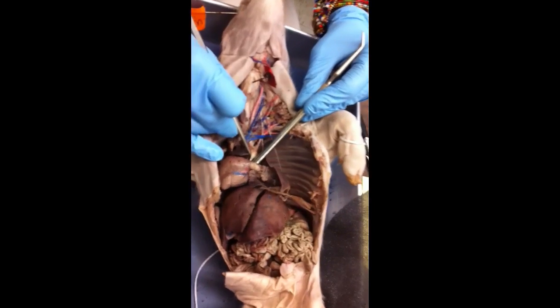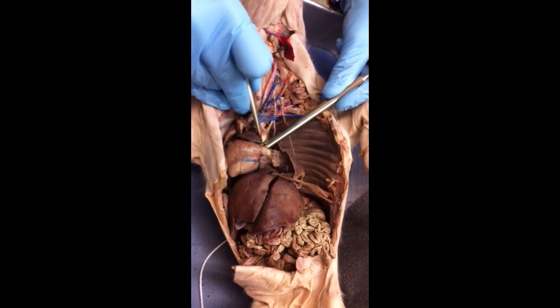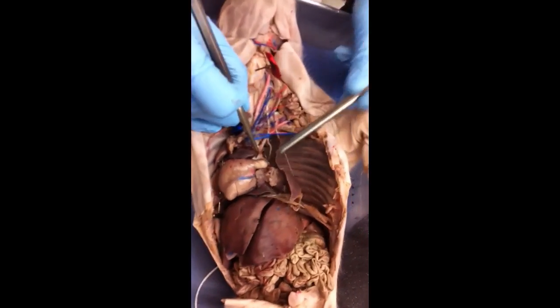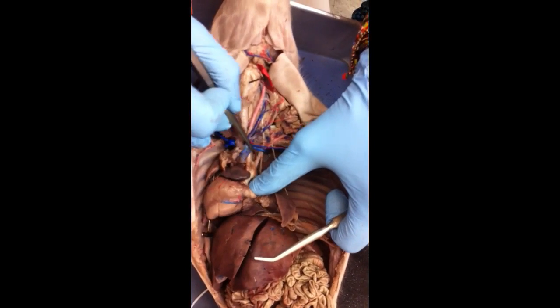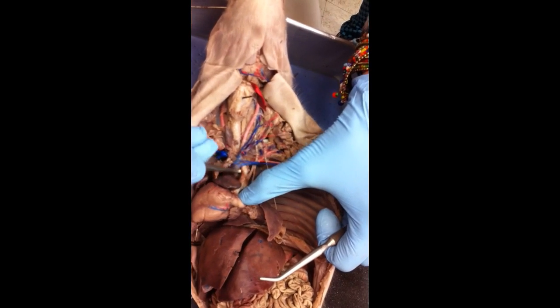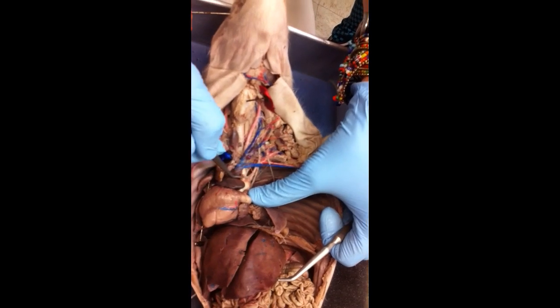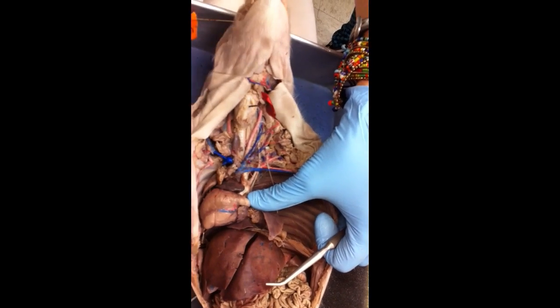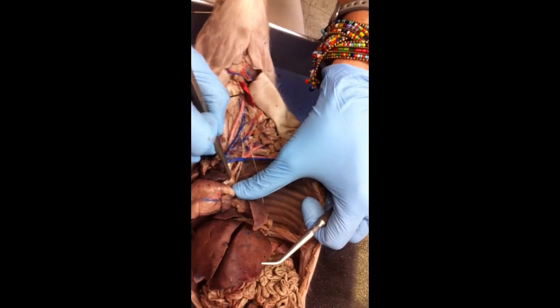So aorta or ascending aorta. But right here, it has this arch, so if you see a pin here, that's the aortic arch. Now, another way to tell that it's the aortic arch, because where the aortic arch is, you see kind of two fingers coming off of it. This and this. So it kind of looks like a peace sign coming up off of the aorta. So this is aortic arch.